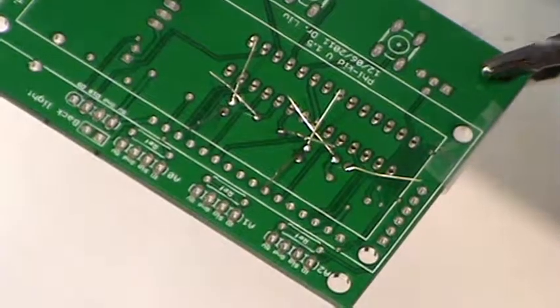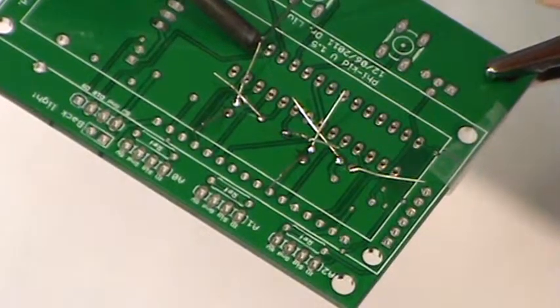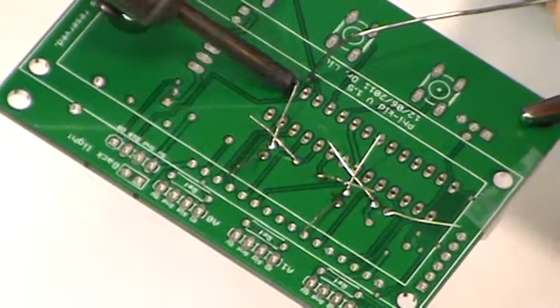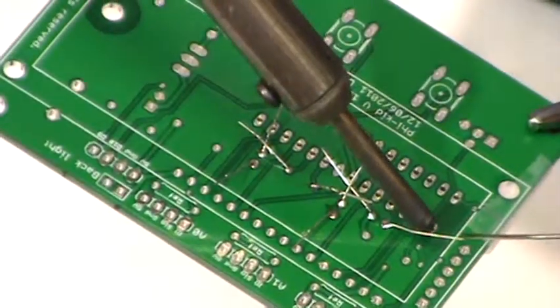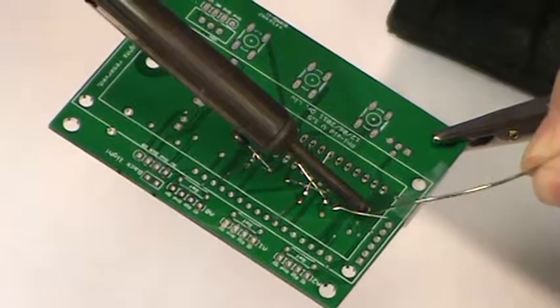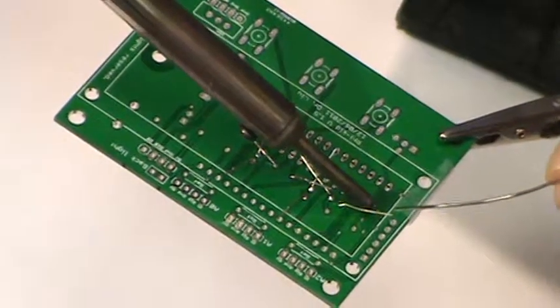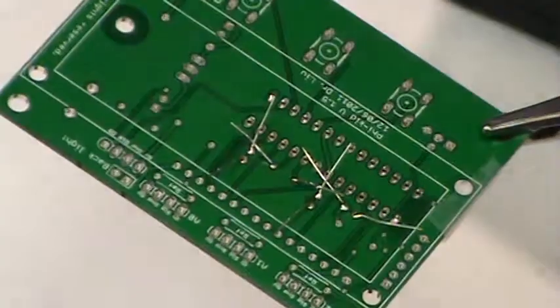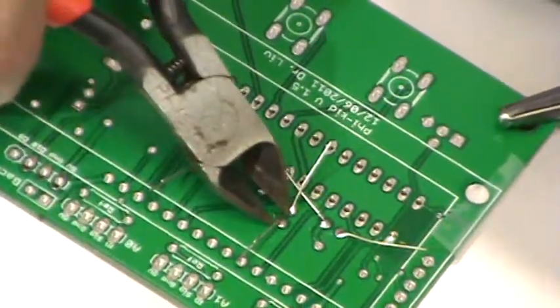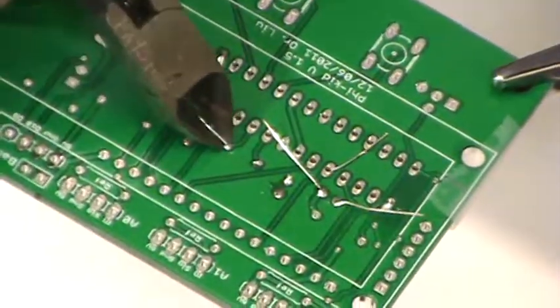Okay, so now the socket, just pick 2 corners, opposite corners. Okay. Make sure you're patient enough to heat up the solder pad. Especially some of the pads are connected to the entire board. They'll take a little longer to heat up. Okay, so now we have everything secured, and I can't wait to cut all these pins. Make sure you wear eye protection, since they could fly at your eyes.